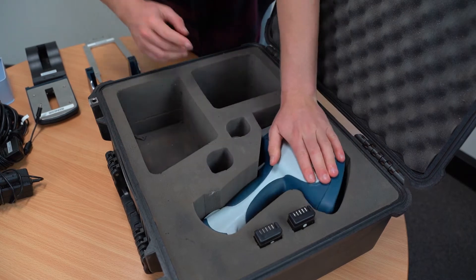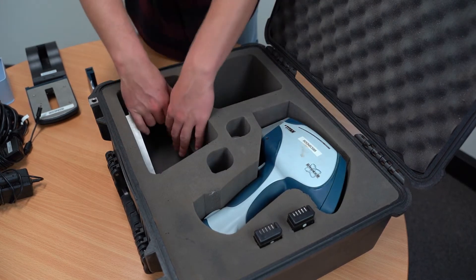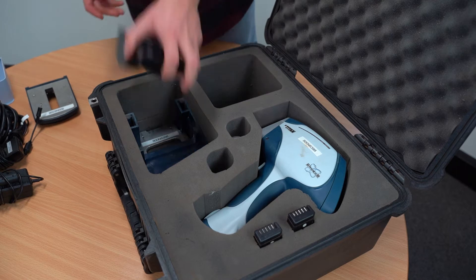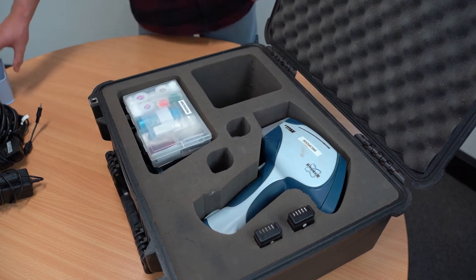After this, the best place to start is with the stand. Place the long silver metal part first, followed by the blue base, then the charging station. You can place the stage like this so that it's curved into the charging station to save room.